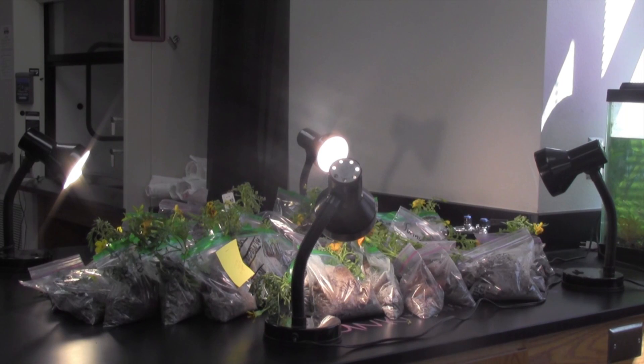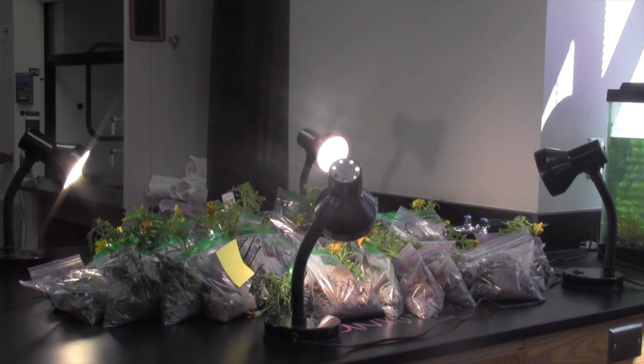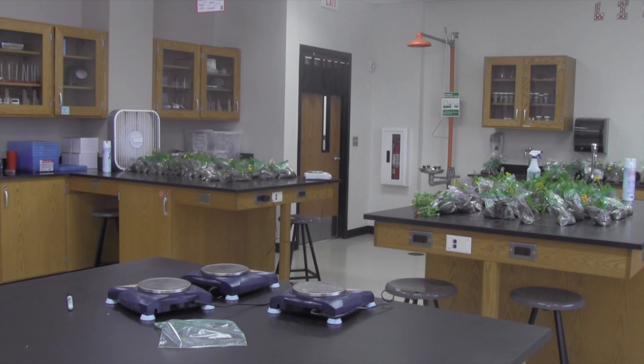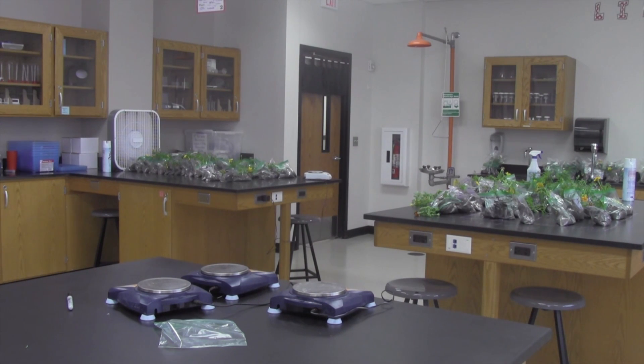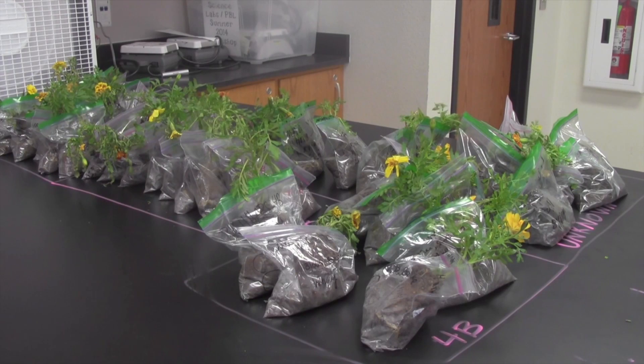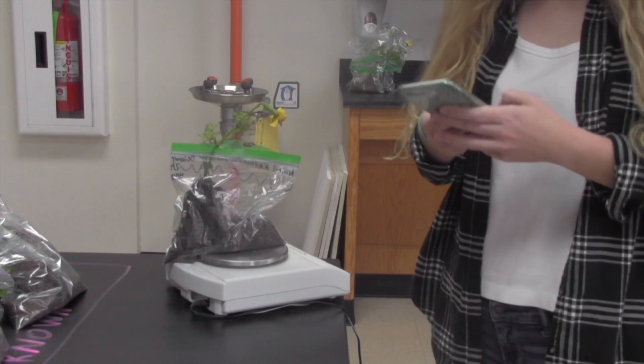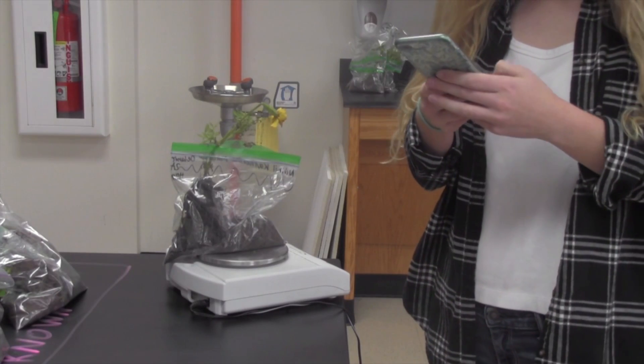Some plants live in windy environments, some plants live in sunny environments, so that's all going to change transpiration. If they're in a sunny environment, maybe the water dries up really fast, so they need more water to replace it. And some of them live in humid environments, where there's so much water that they don't have to transpire at all. This lab is supposed to show you how one plant can be affected by a different environment.